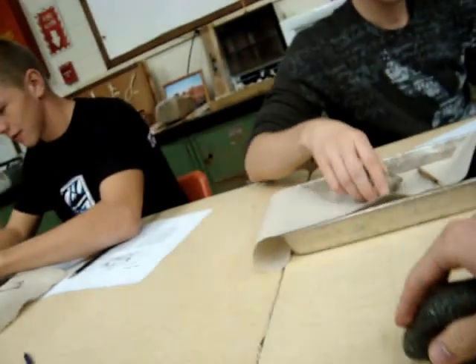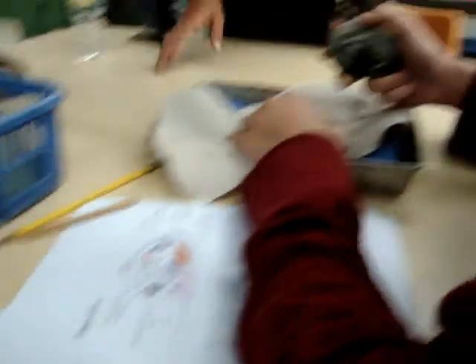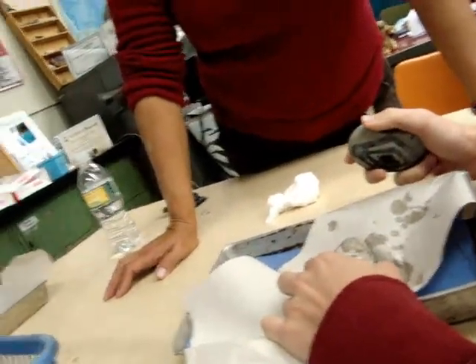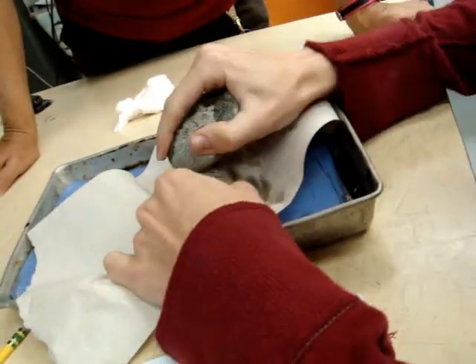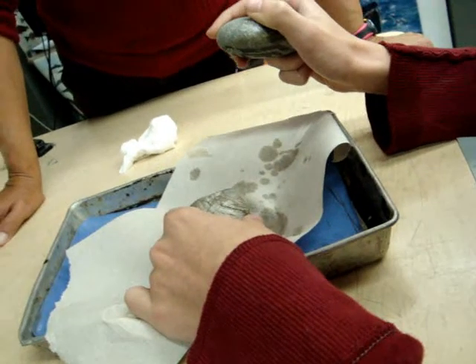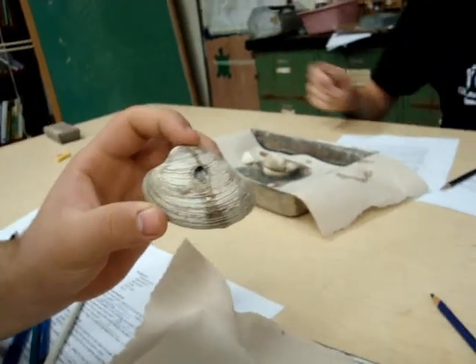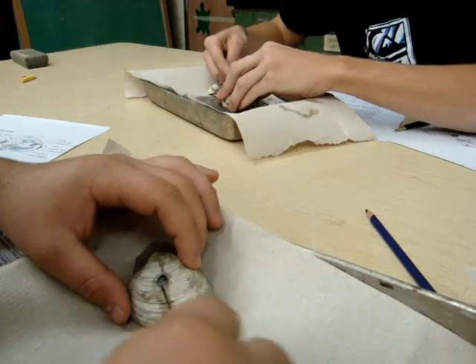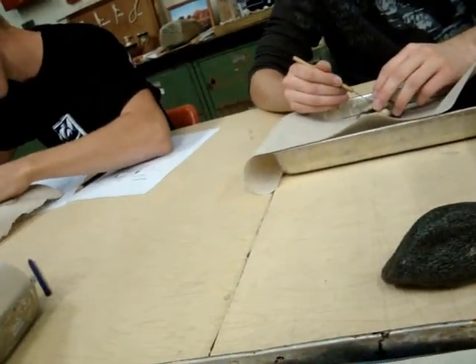Did you get it? Is this the top? Yeah, but the shell's all there though. See how it's aiming in that direction — the longer part. Are you supposed to hit that? Right in the middle — like right here? Yeah. I hear you knocking. So now what? Keep going. Rip it apart. Is this hole too small? No. Wow. Is that the only hole, or is it cracked all the way through? No, it's the only hole. I did a good job. Look where the adductor muscles are. All you have to do is break through the adductor muscles.